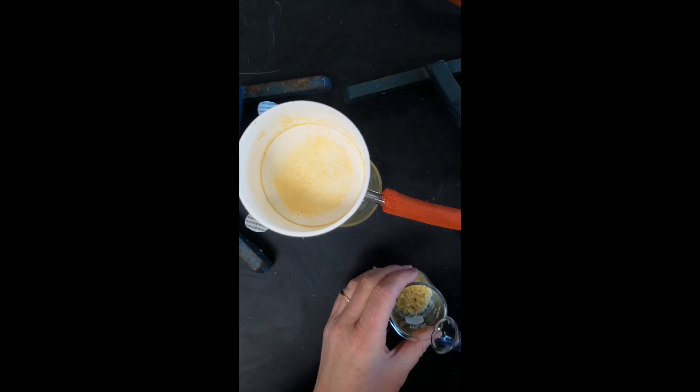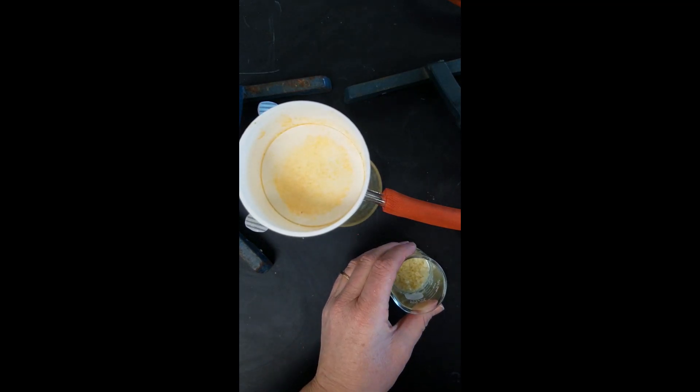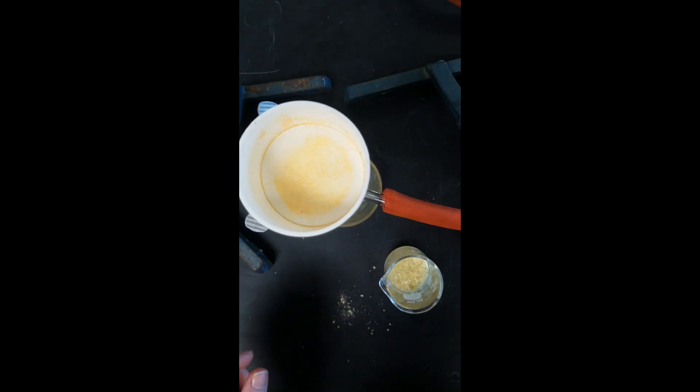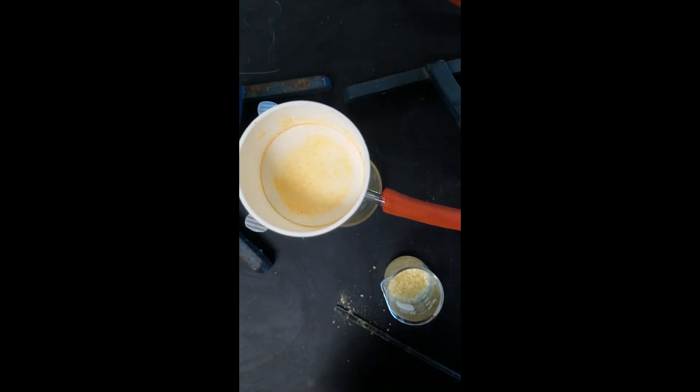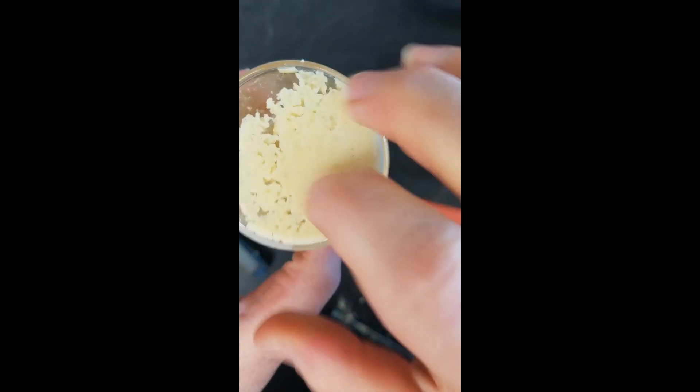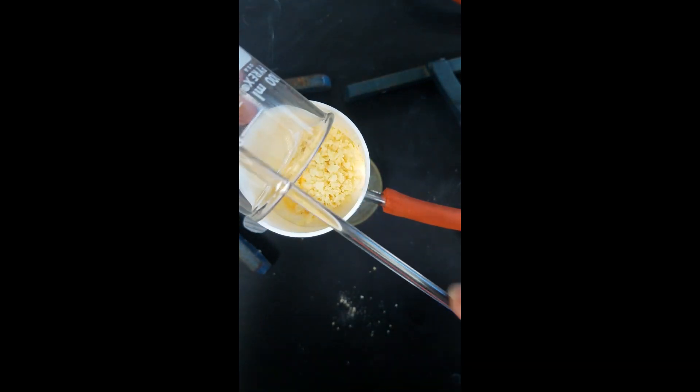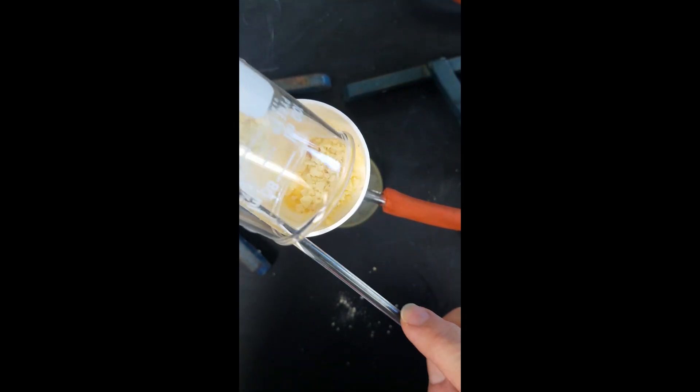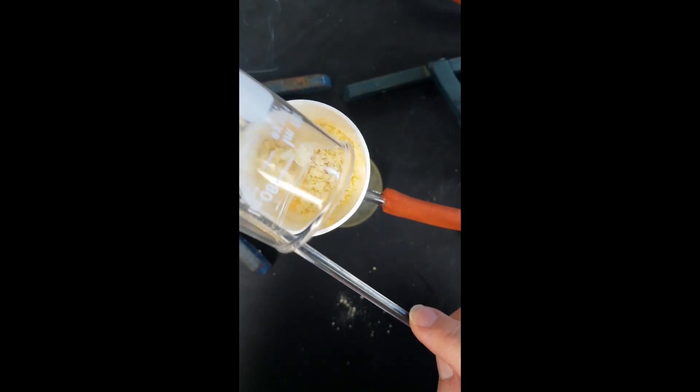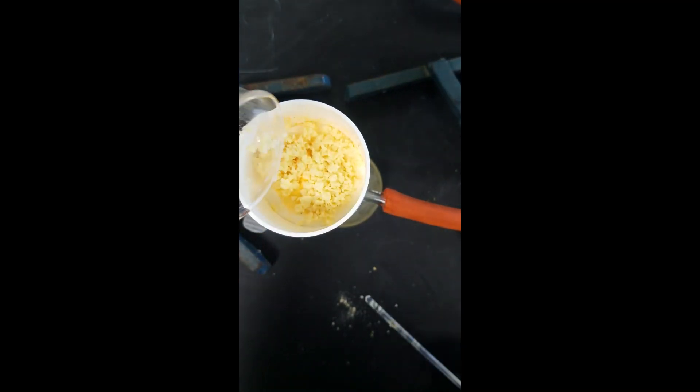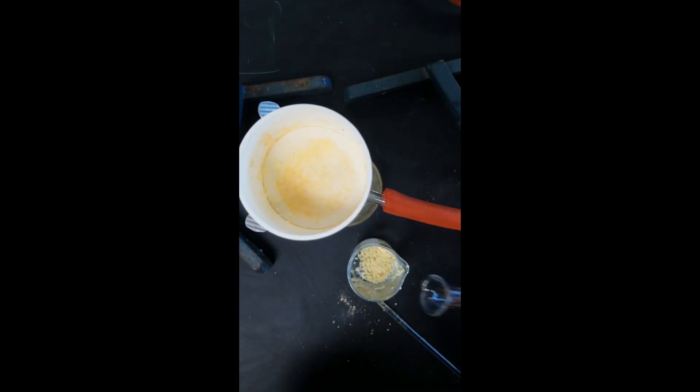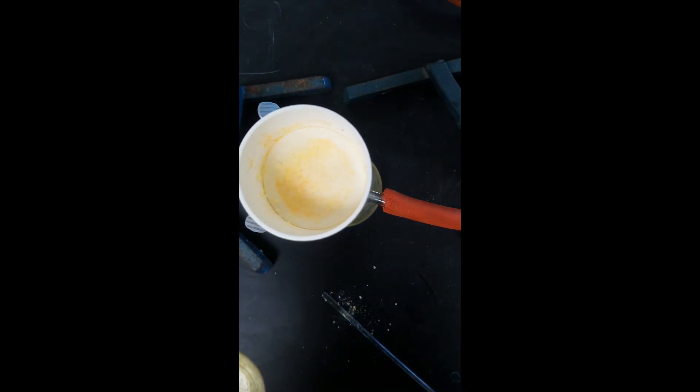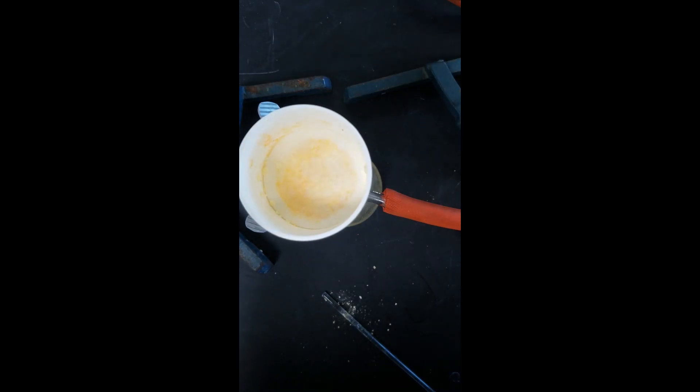Here's the first addition of our petroleum ether to our Pringles. First filtration of our Pringles. Here is the second addition of our petroleum ether. Here is the second filtration of our Pringles.